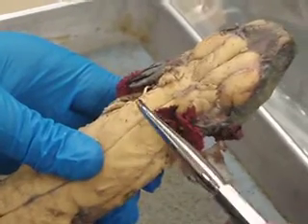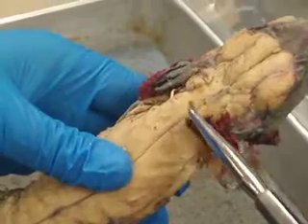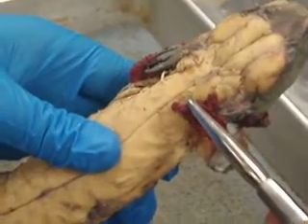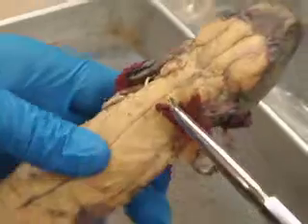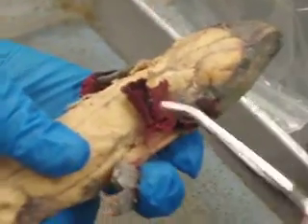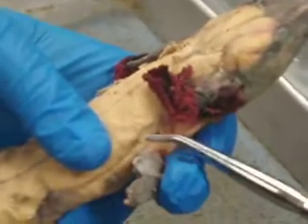The dorsalis scapulae is right up here on both sides. And then we have the triceps brachii, which functions to extend the forearm.